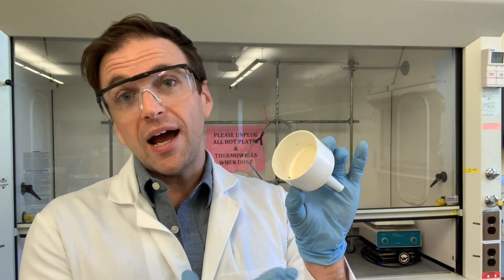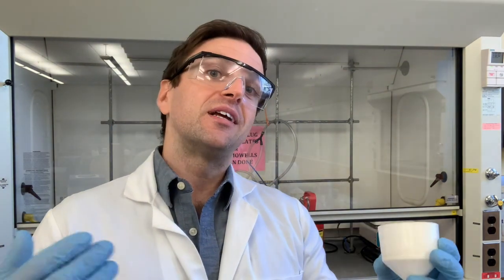Now, at this point right now, we would have to let this dry out. It's still wet from the vacuum filtration. We would get a yield to see how well the reaction proceeded, and then get that spectroscopy. But that will fall outside of the scope of this video, which focused purely on the synthetic procedures to obtain the product. Okay, well that wraps up this video on the synthesis of 2-butoxynaphthalene via an SN2 reaction.